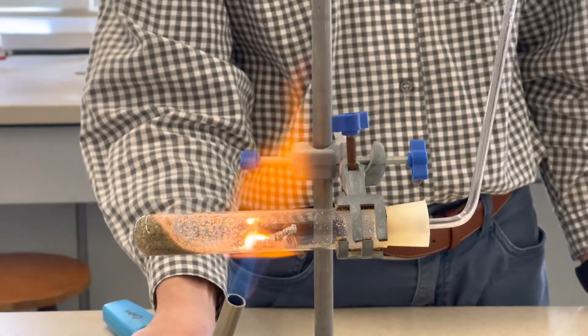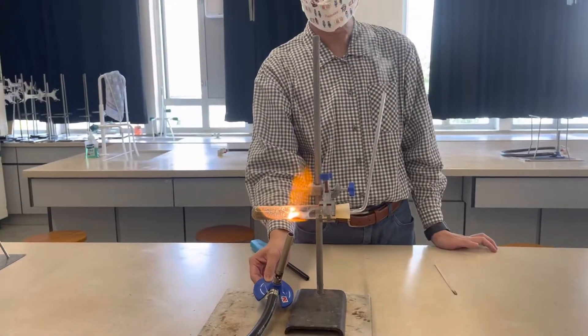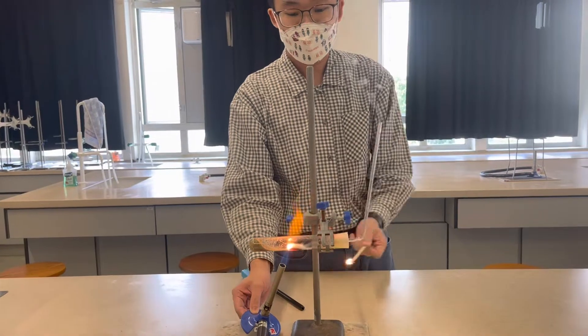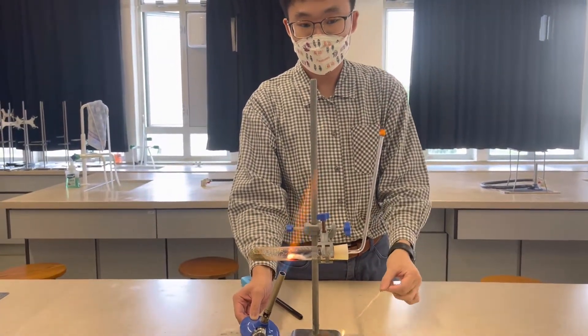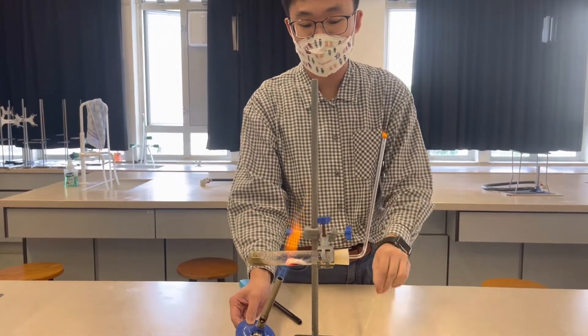And when you see it starts glowing. Can you see it starts glowing? So when it is glowing, there is a generation of hydrogen gas.